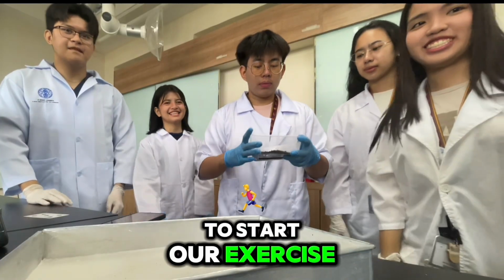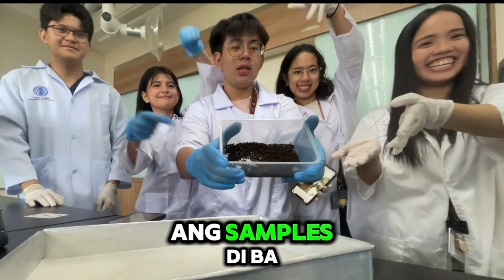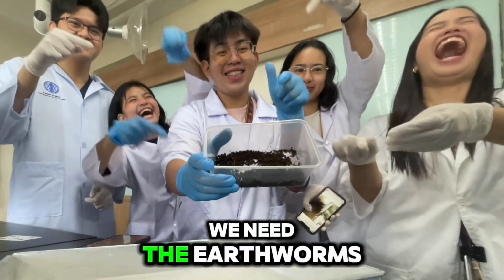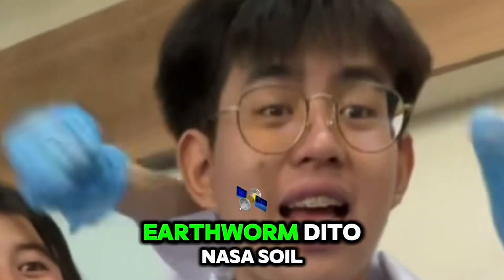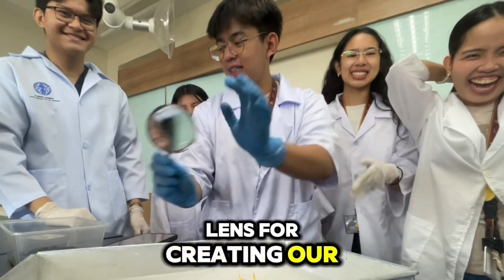To start our exercise, we need our materials. Of course, we can't be the samples, right? First, we need the earthworms. Hey, that's not the earthworm. Here, in the soil. Next is our hand lens for creating our heat stimulus.